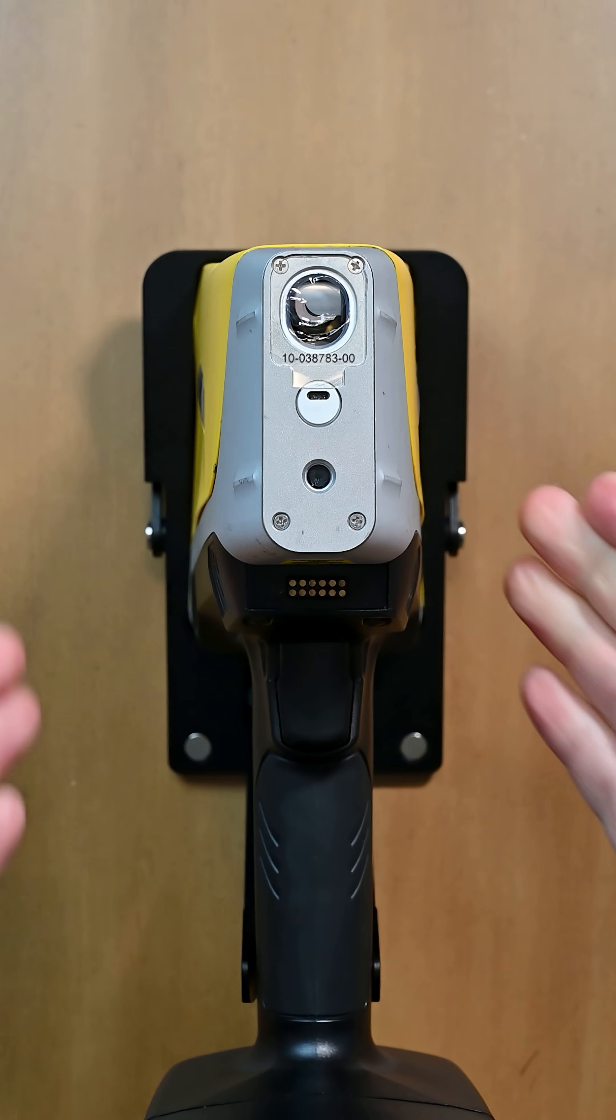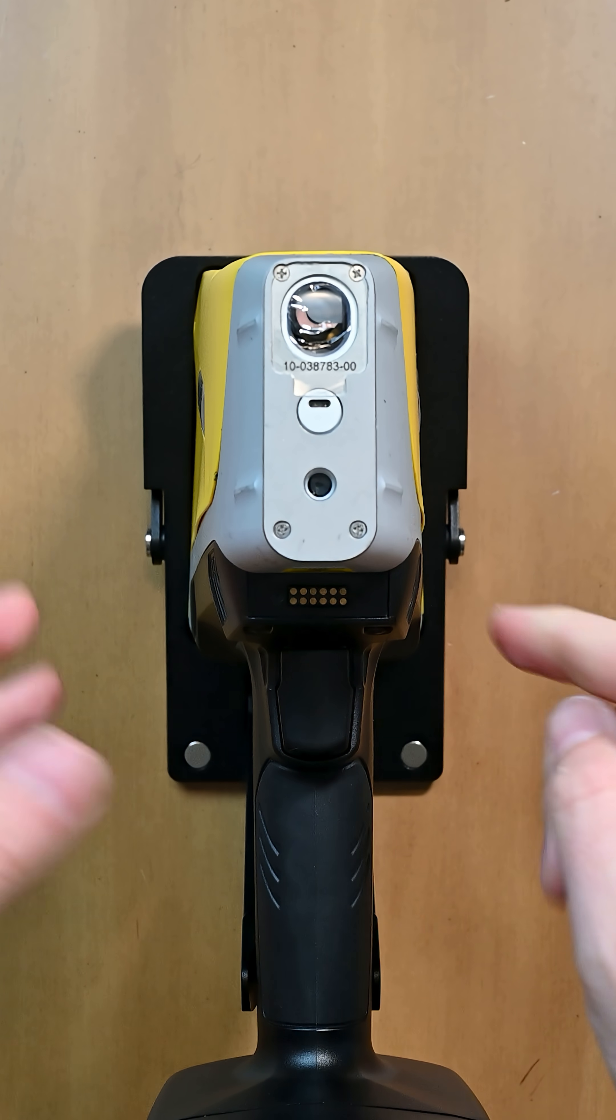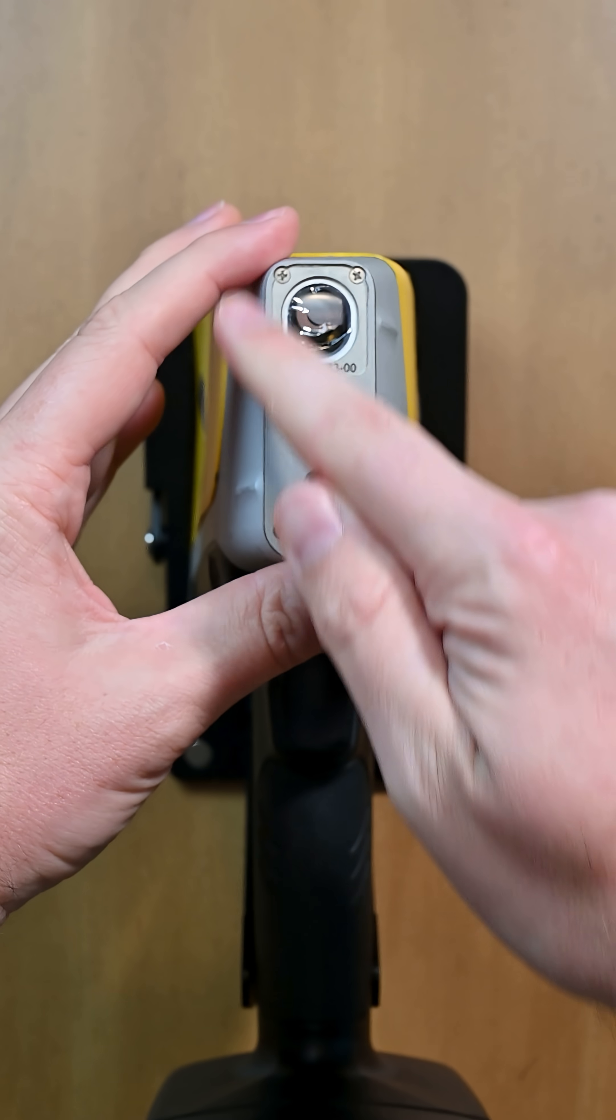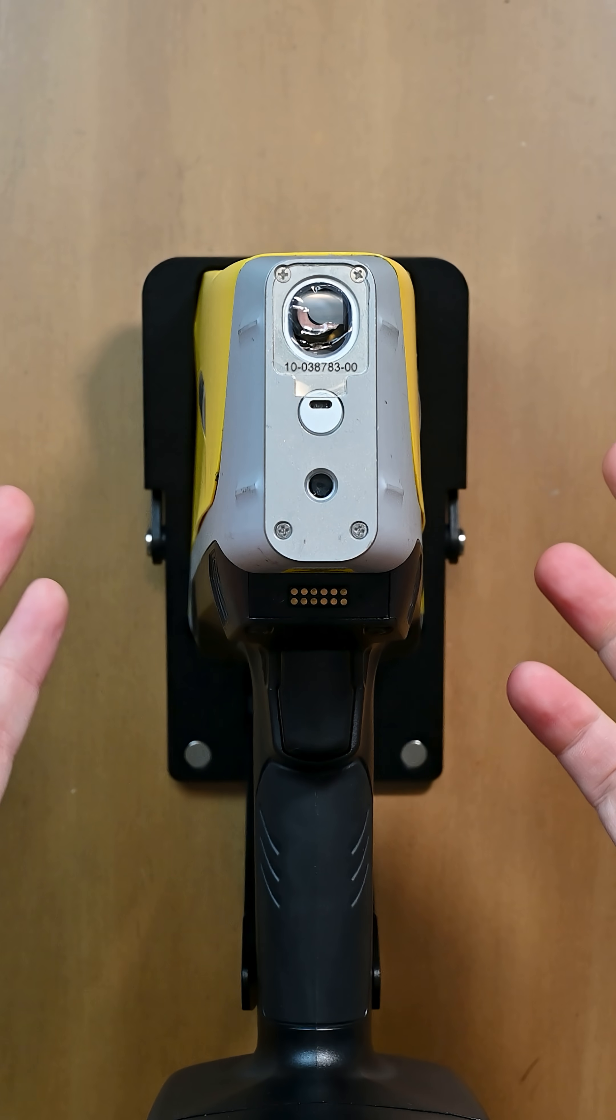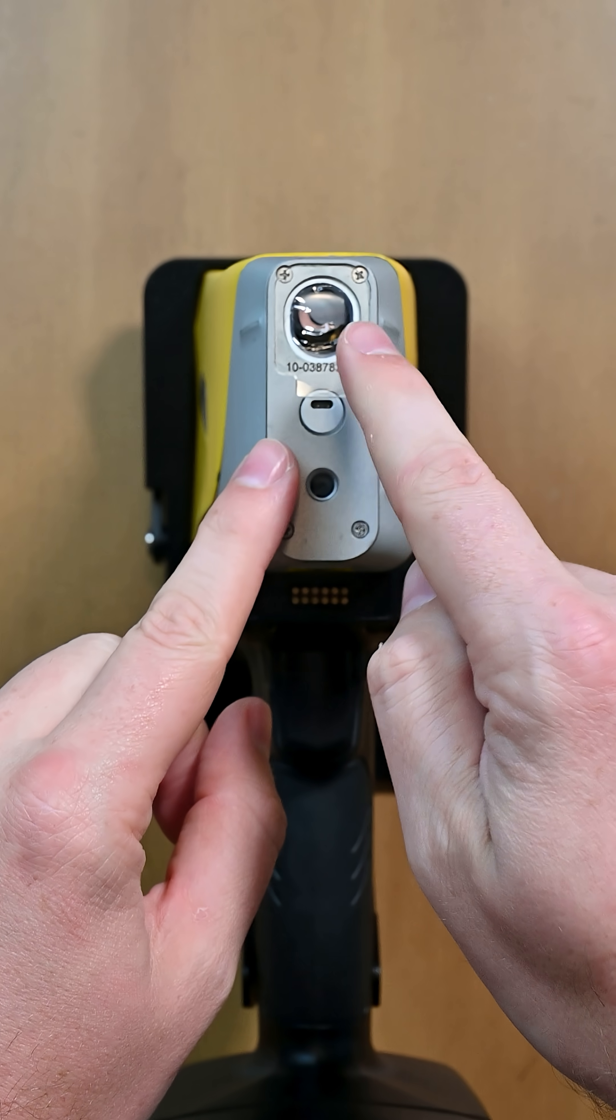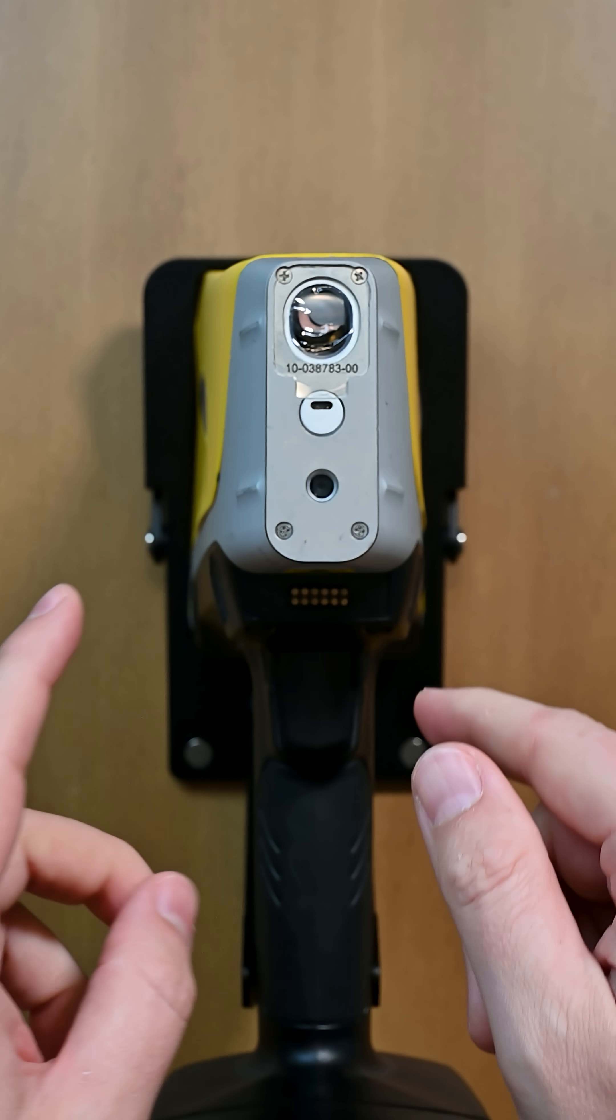Now if you do have a Fieldmate test stand, the base makes a great thing to do. Just make sure you don't get any powder if you're doing powder type testing inside the analyzer itself.